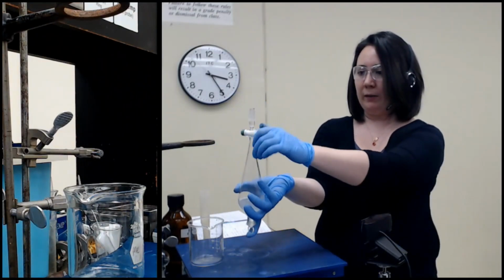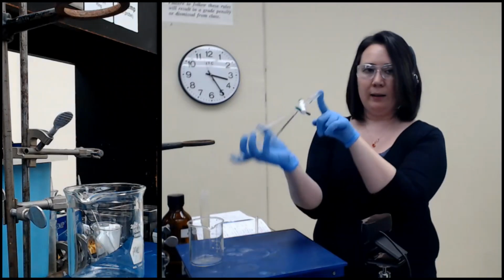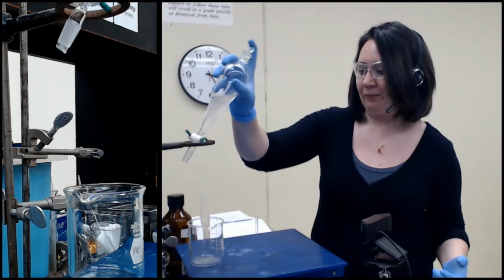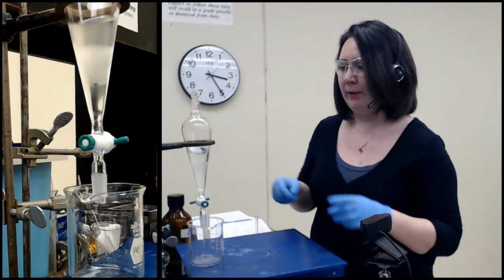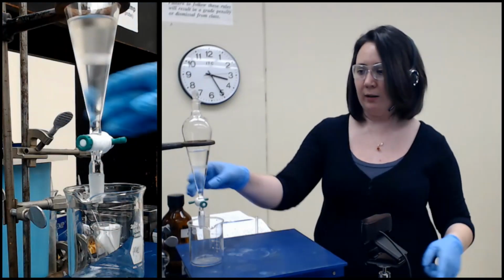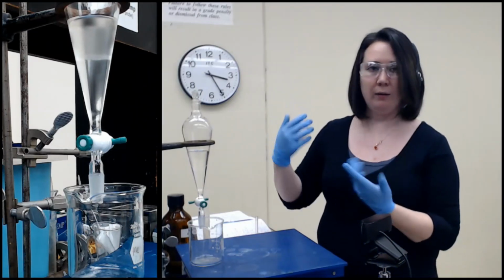And then every so often, we open it to vent it. Make sure you don't point this at your face or at someone else's face, especially when we get to work with people in the lab again. Actually, probably the worst accident I've ever witnessed in the lab was somebody who was doing everything fine, working on their bench. The person next to them was doing an extraction, wasn't paying attention, and the whole top just flew off into the lab partner's face.